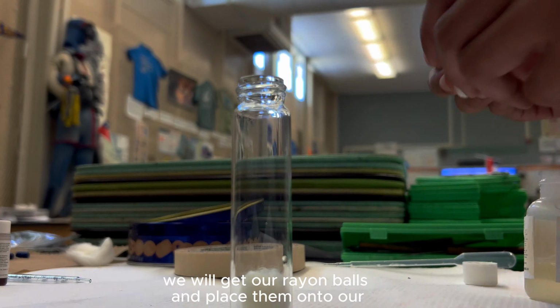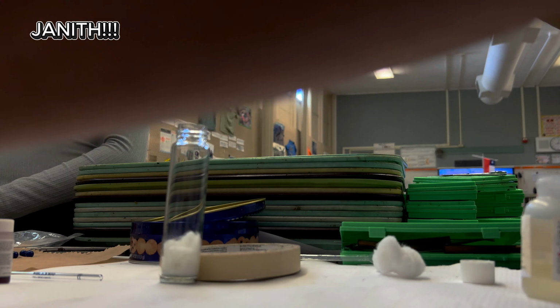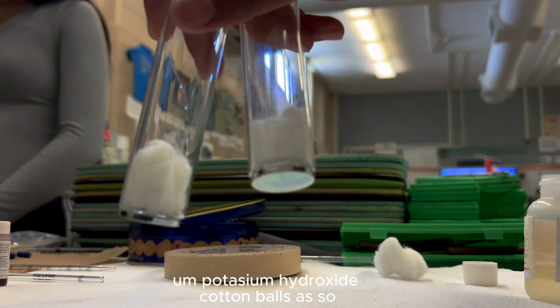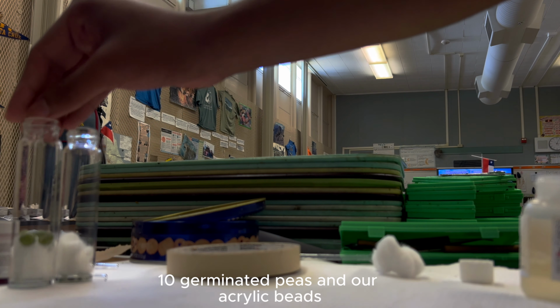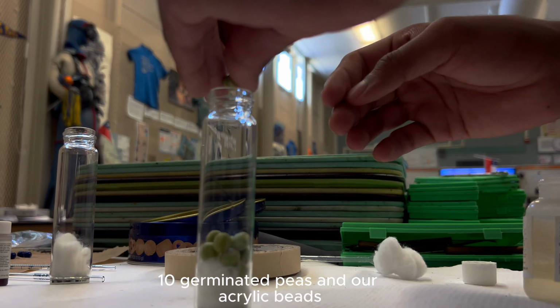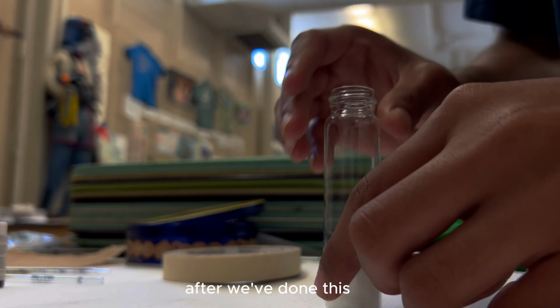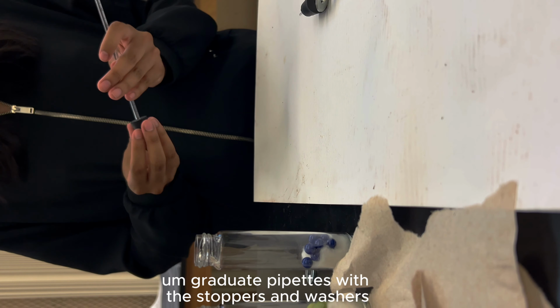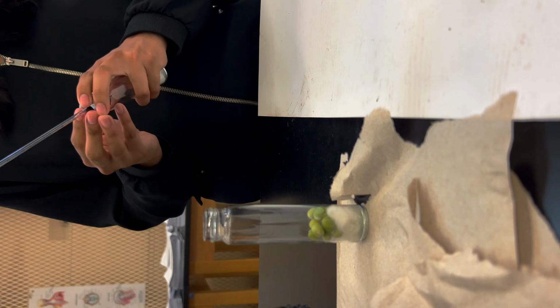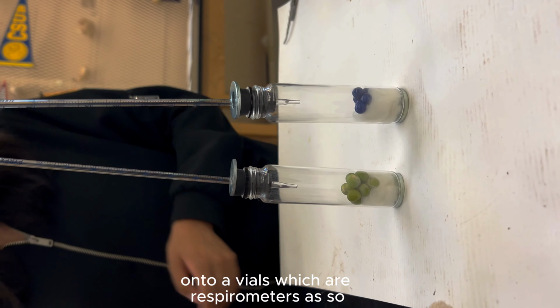After this process is done, we will get our rayon balls and place them onto our potassium hydroxide cotton balls, as so. Now we will get our germinated peas, 10 germinated peas, and our acrylic beads, 10 acrylic beads. After we've done this, as you can see, Marely is placing the graduated pipettes with the stoppers and washers onto our vials, which create our respirometers, as so.